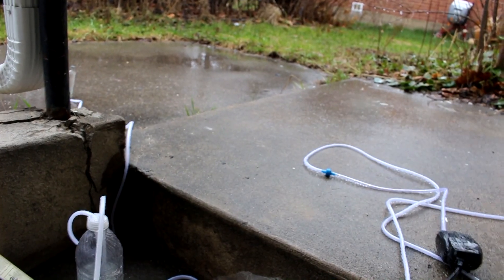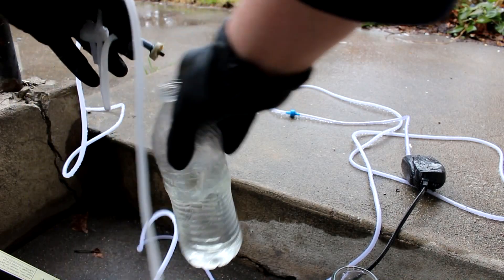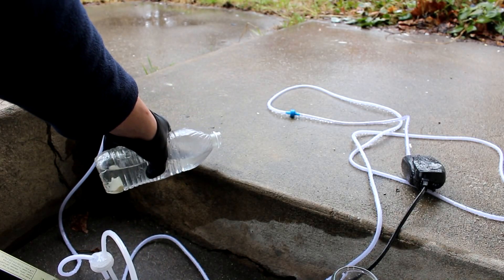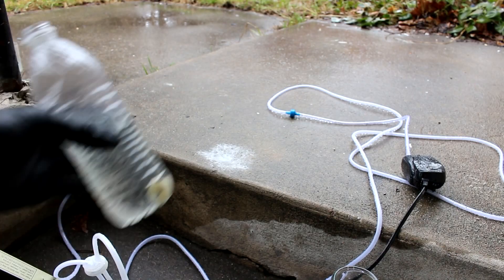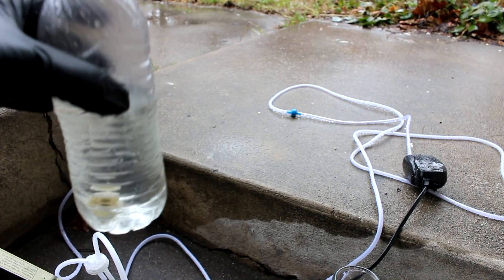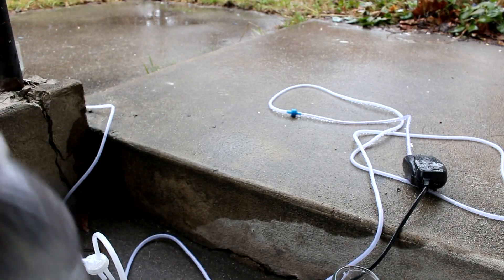I had to stop the time-lapse camera because it started raining, and the air pump probably didn't fare too well. Let's see how much acid we caught — that bubble stone has seen better days. Pouring it out on the concrete: it should fizz if it's got acid in it. Yes, it's fizzing — not super strong, but I've recovered some acid. A definite benefit of running the gases through water was creating very little fumes; only occasionally when I added another shot of acid did any fumes get through. Maybe I'll build a more sophisticated apparatus sometime.